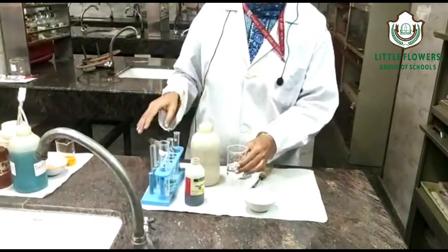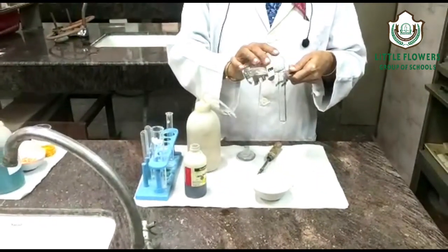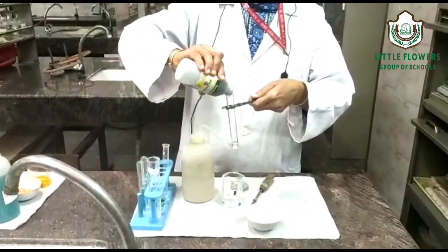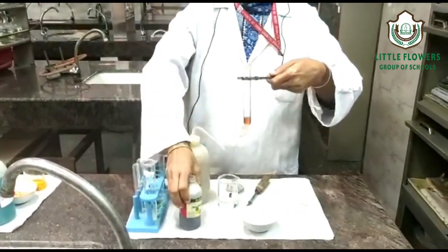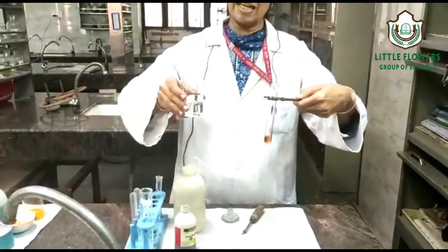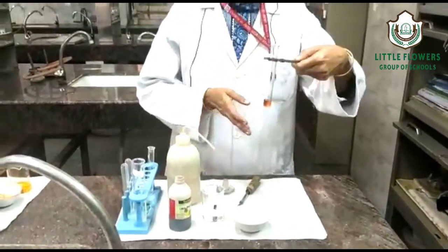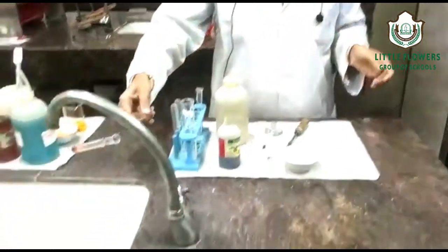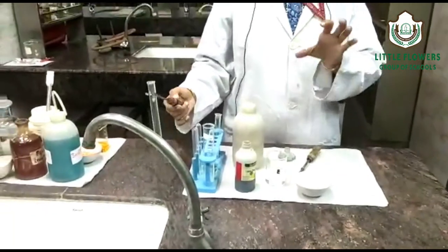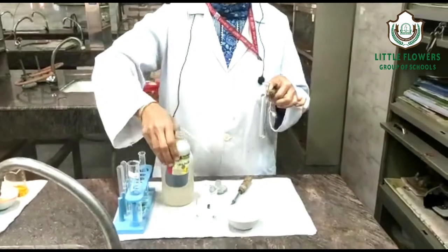Solubility in water. We take the organic compound and add blue litmus solution. See, it is clearly red in nature. This means the organic compound is purely acidic in nature.